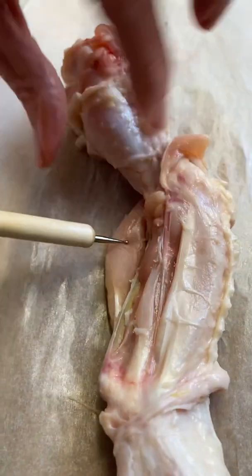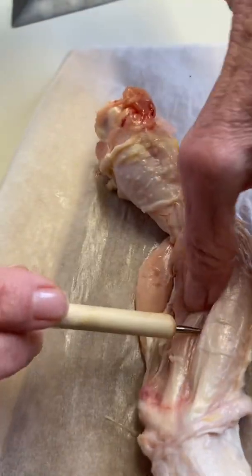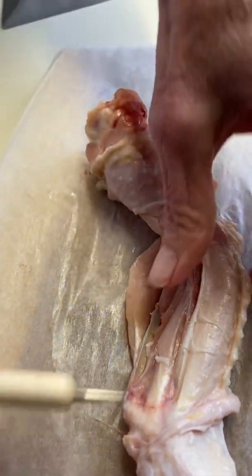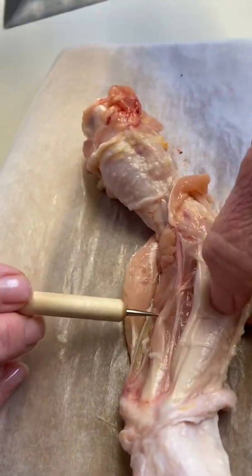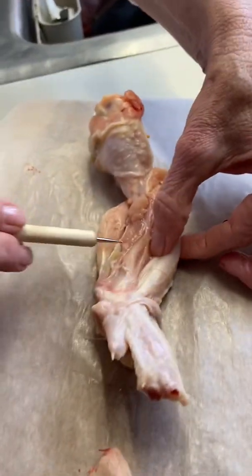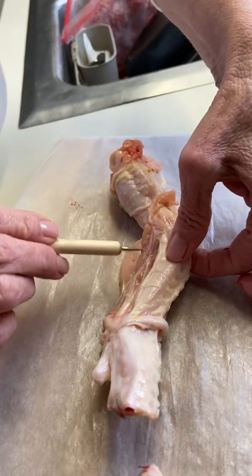Skeletal muscle, this here is a good muscle to just label out because it's dissected and the skin's uncovered, but we have additional muscle here as well. And as far as a nerve, I think I can get you a nerve here. Hold on one second, because it's going to be a little white thread-like structure.